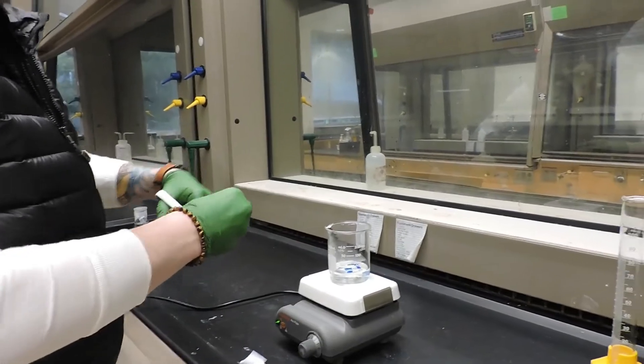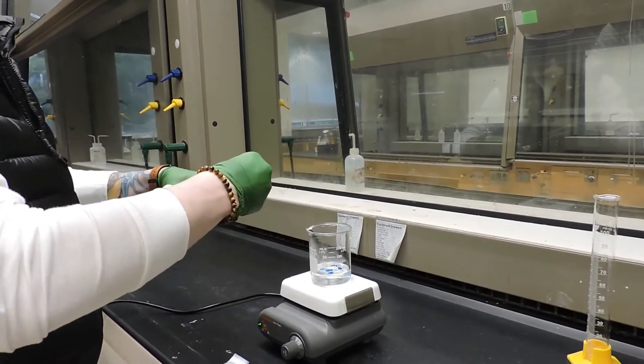So now he is going to stir the mixture once he has all his pieces cut up.